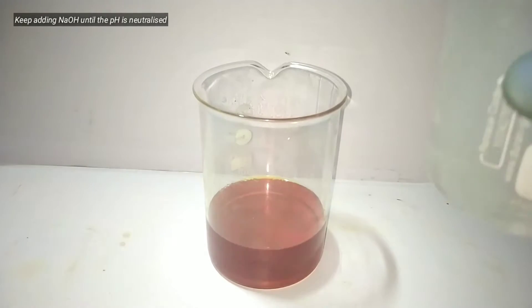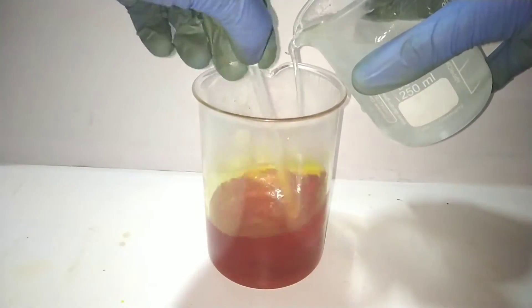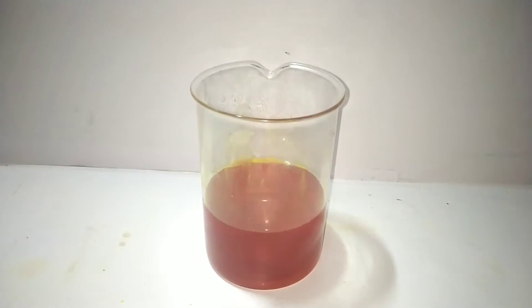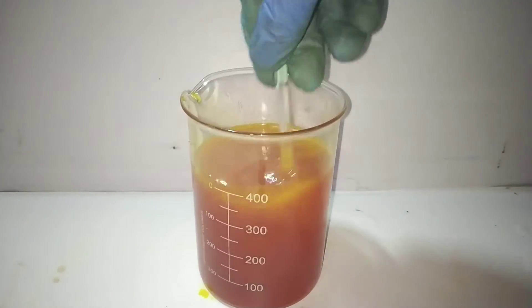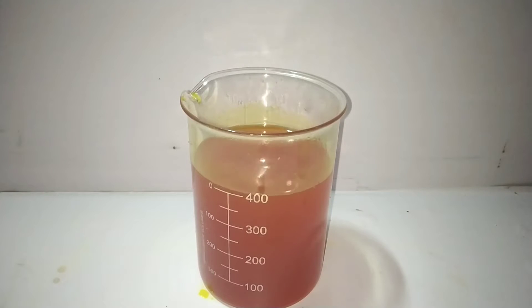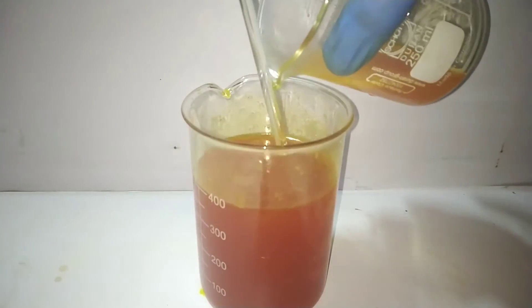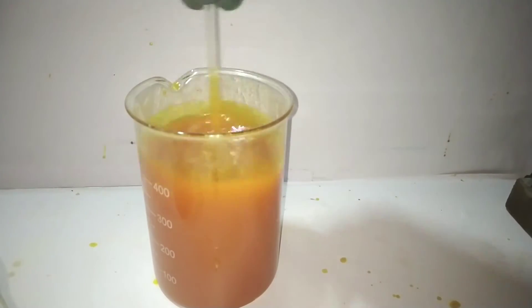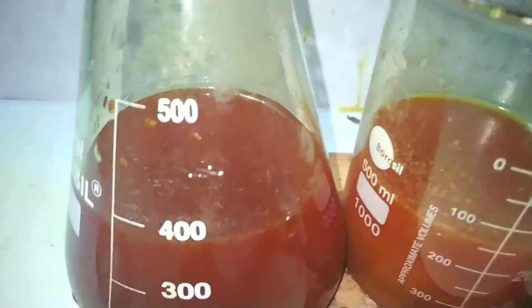Now I add 10% sodium hydroxide solution into it until the acid gets neutralized. After adding some amount, I realized this would require a lot of sodium hydroxide solution, so I made a more concentrated solution. This made the reaction with the acid extremely exothermic and the solution started to splash. I slowly continued adding sodium hydroxide solution until the pH became alkaline, tested with litmus paper. Despite the violent exothermic reaction with splashing, I was finally able to neutralize the solution and obtain crystals of paranitroaniline.